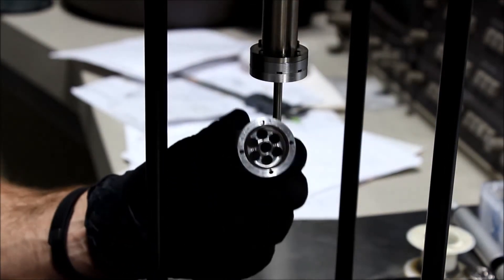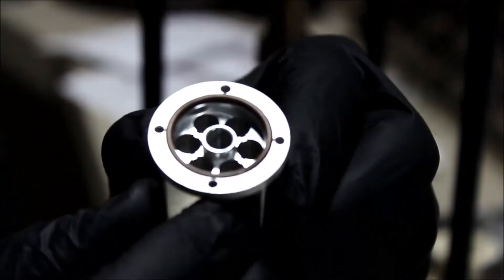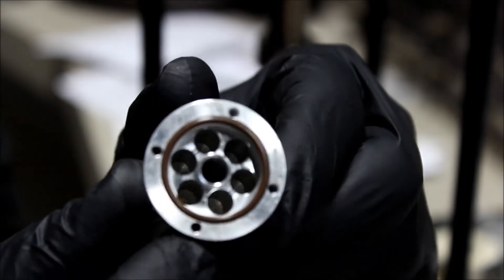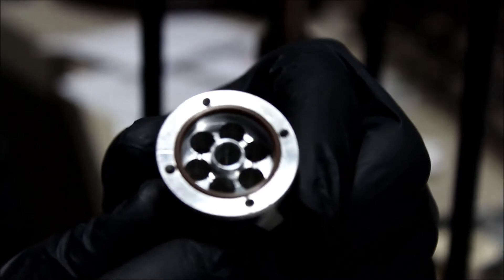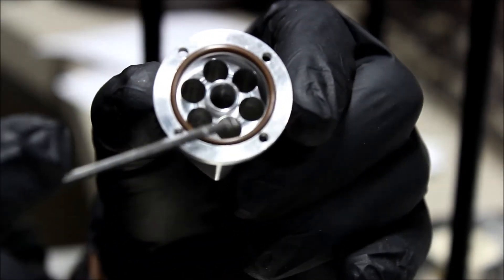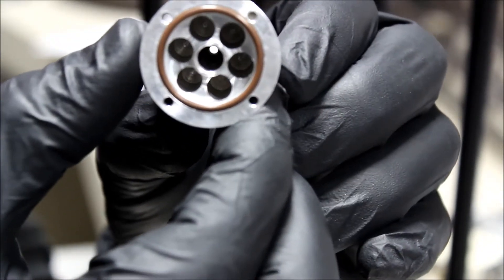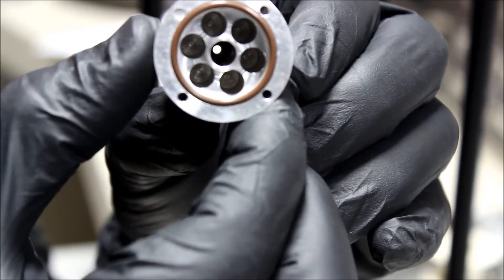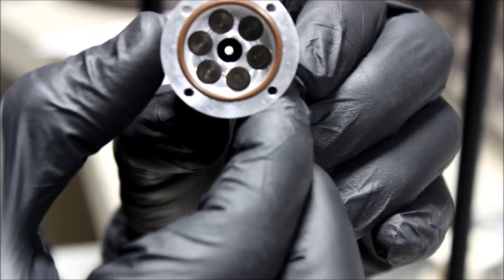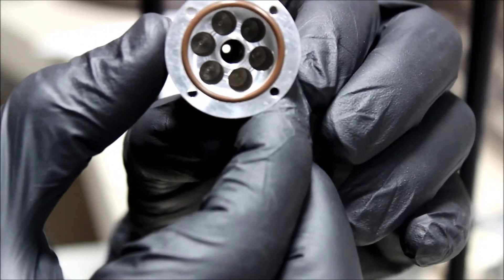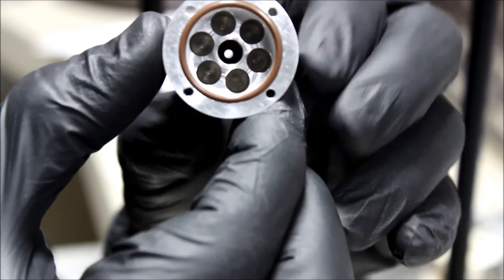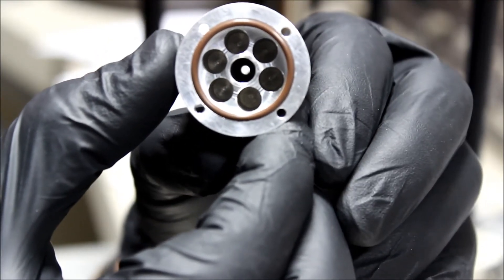You can see the plunger rod on the end of the gas injector and you can see the crucible. Let's zoom in to that crucible. The crucible is composed of several little holes. In the center hole where the plunger fitted, that is the passage for the gas to escape the crucible. You can see there's a little hole in the bottom, and that leads to the needle. Right around that little hole there's an o-ring seal, and that o-ring seal seals against the end of the plunger and that's what forms the valve. By turning that thumb screw, we open the valve manually.